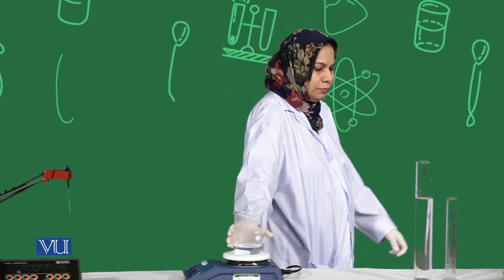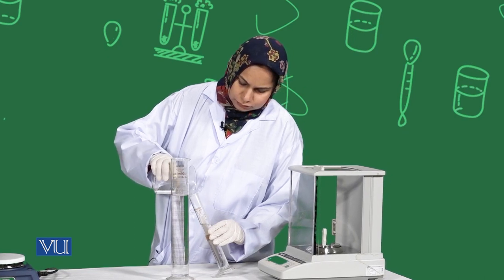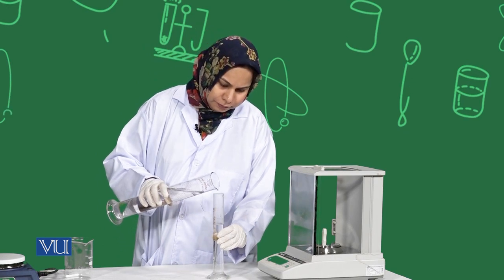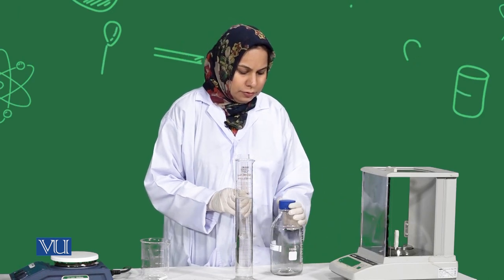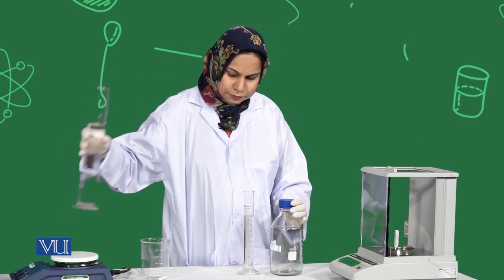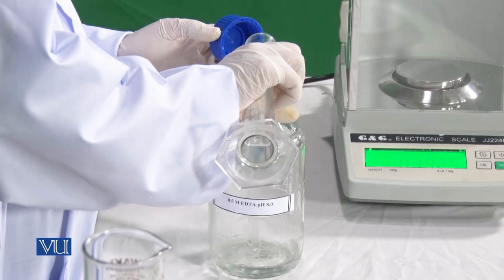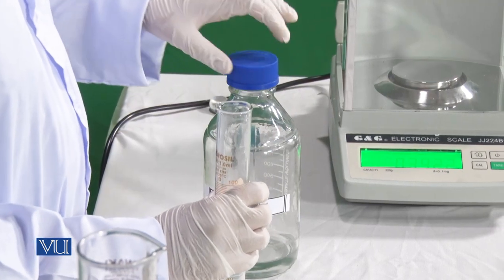After the buffer solution pH reaches 8, you can see that its color becomes clear. Now finally we are going to make the volume up to 100 ml with the help of a measuring cylinder. This is 0.5 molar EDTA solution — 100 ml has been prepared. We can store it in a clean reagent bottle. This stock solution can be used for a few months if stored at appropriate conditions.